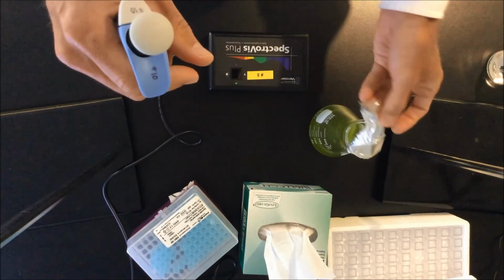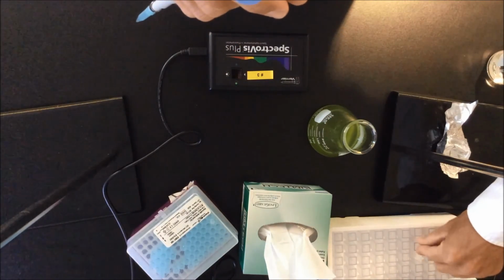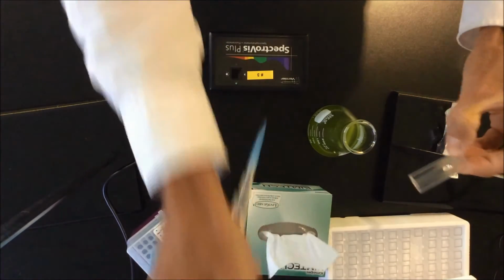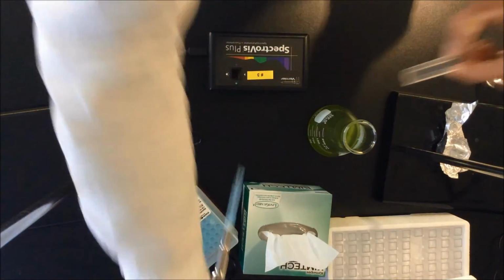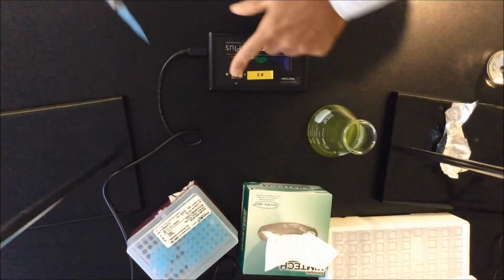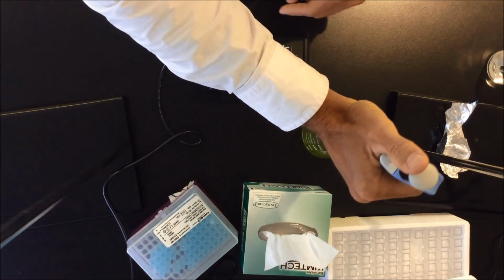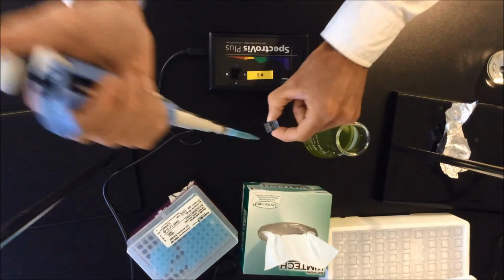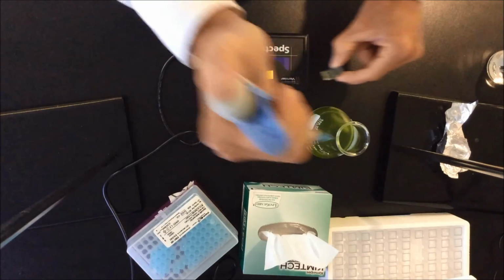Open the algae. Be very careful with our babies here not to spill anything over. You take a new cuvette, you take a wipe, you clean it correctly, you do not put your fingers on it. Now the arrow needs to go with the arrow, like that. And once again, you're going to be taking algae. So one stop, I go in, and be sure you stir the algae. The algae should be on the stirring platform anyway. Take the cuvette, fill it with 3 ml, put it back in, and then you can go and take your measurement.